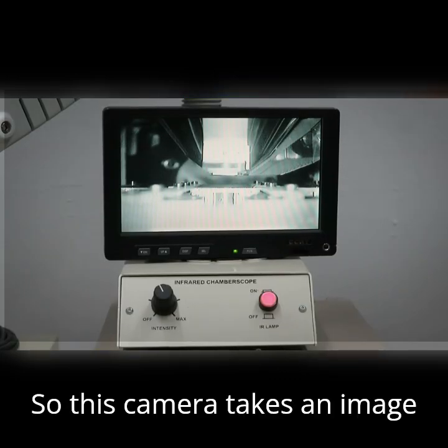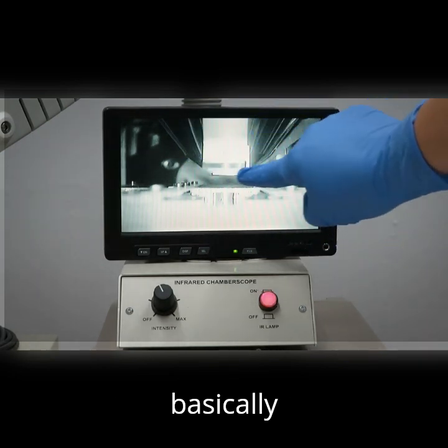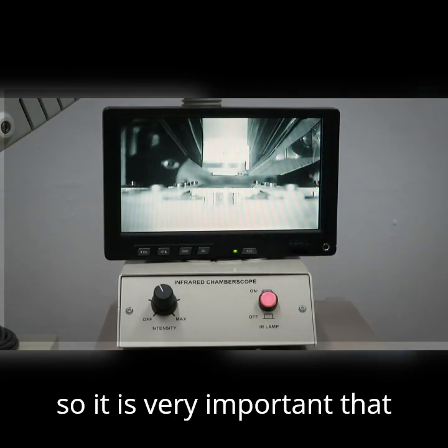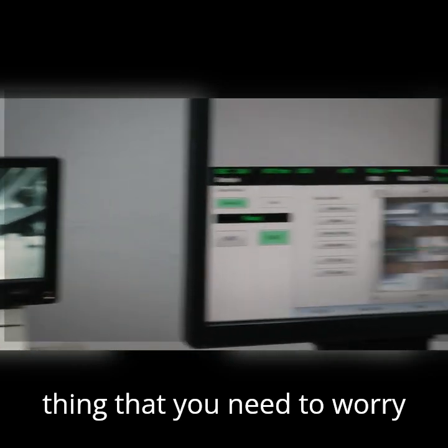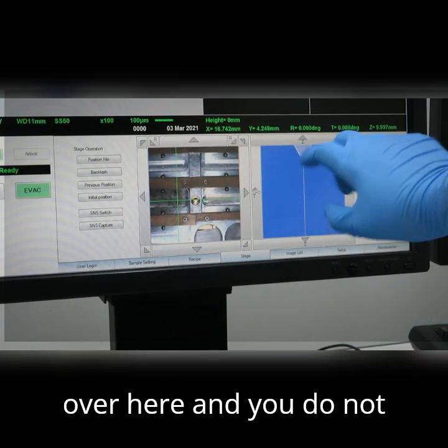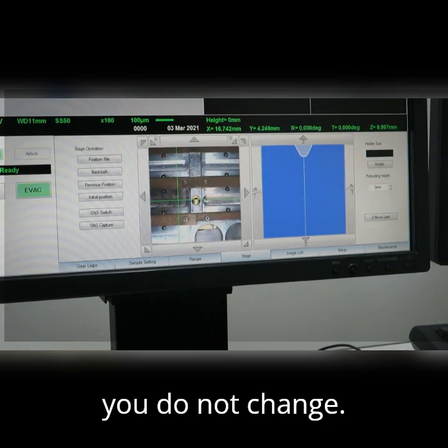So this camera takes an image from the inside of your chamber where your sample is. Over here you can see the sample holder, and this is basically where your beam comes out. There's a backscatter detector that sits at the bottom of this cone, so it is very important that you do not collide. The only thing you need to worry about is don't touch these settings. You do not change the Z over here, and you do not rotate or tilt the stage. So R, T, Z you do not change.